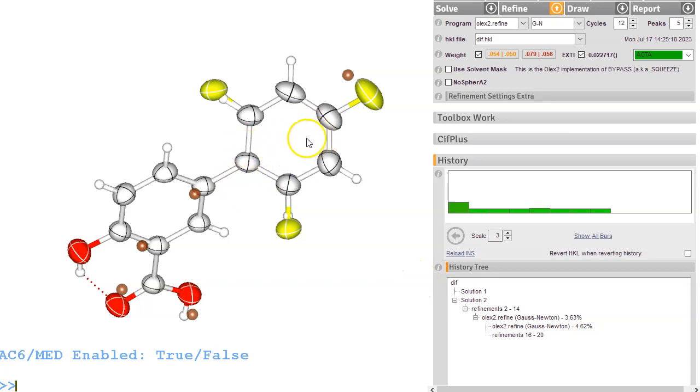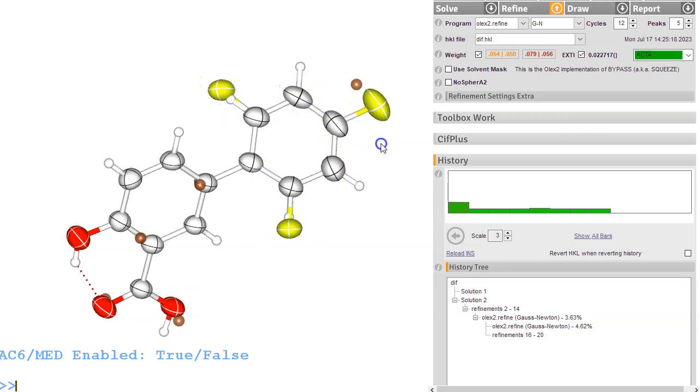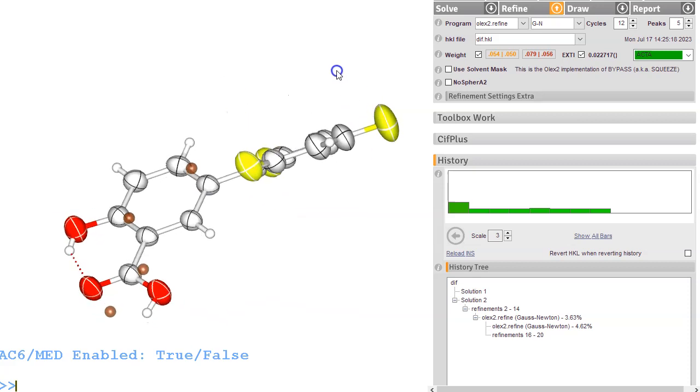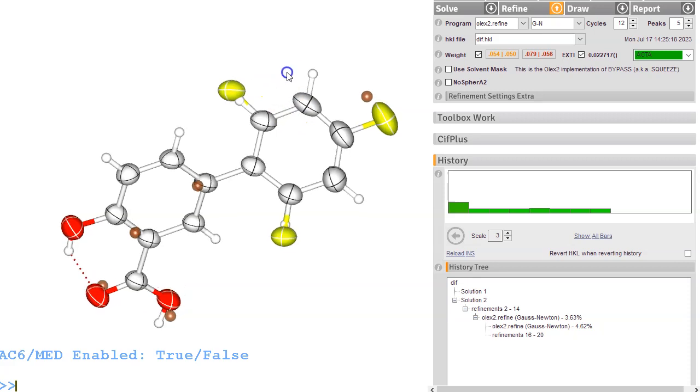When I modeled this structure, this disorder, I just concentrated on these two atoms and I ignored the slight elongation of these rings here, and it looks like maybe this phenyl ring isn't ideal. So there's an alternative way of doing this.